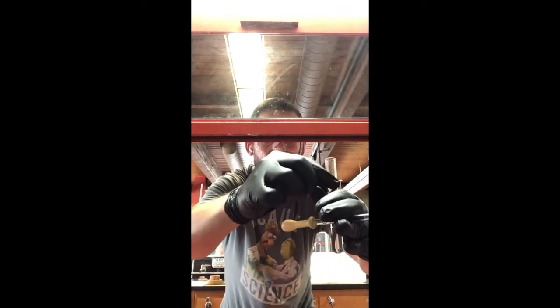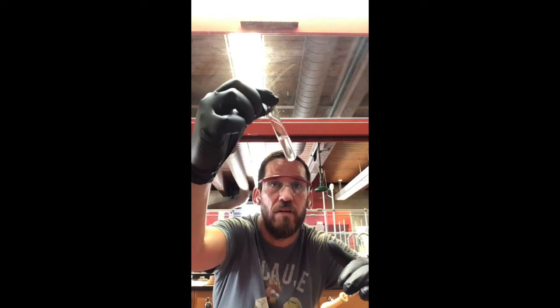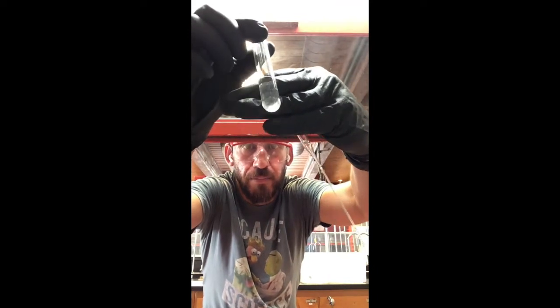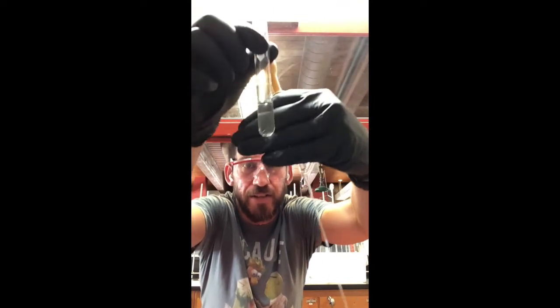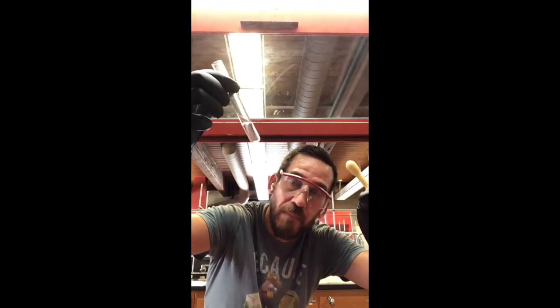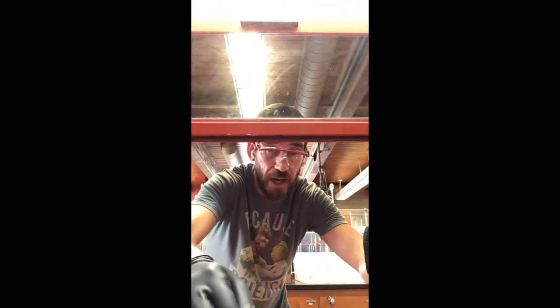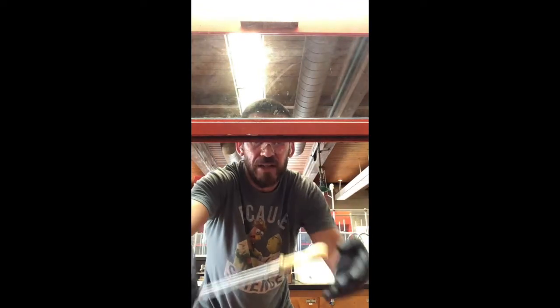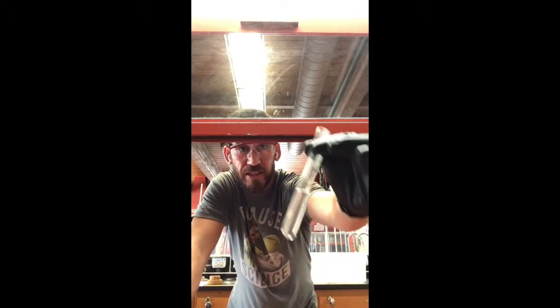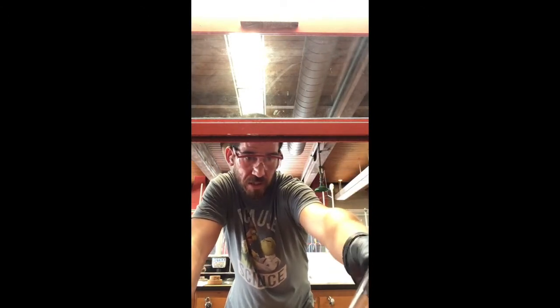And it looks like we might have a tiny, tiny bubble at the bottom, so tiny you can't even see it. I can see it, but I'll tell you what, it's not worth trying to get, because I'm probably going to introduce more water into this than I would want, and any introduction of water I don't want.